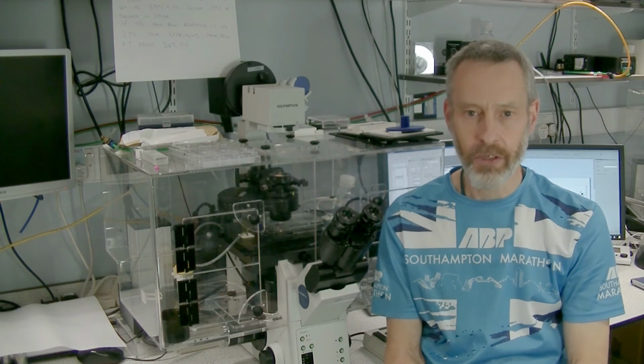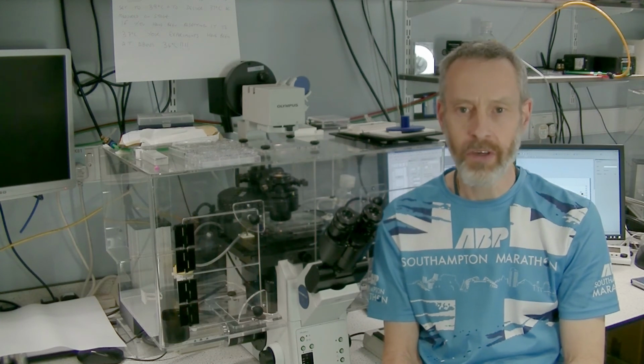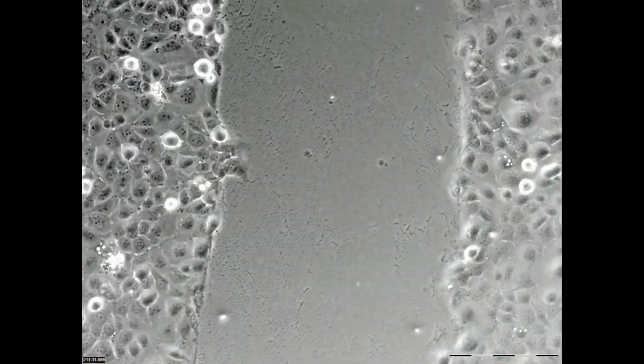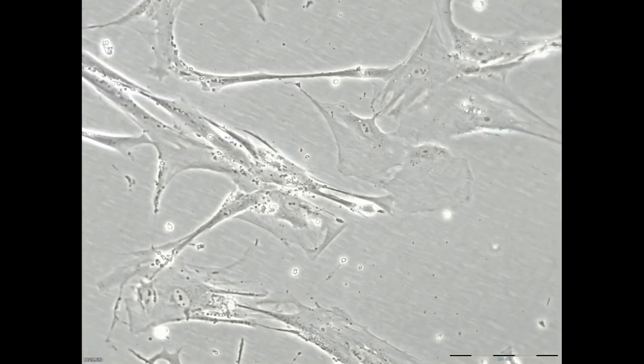Many cells in our bodies are not inert little blobs that just sit there. Many are actively motile, moving around or continually exploring their environment. Let's take a look. Here we see the sheet of cells on either side of a scratched wound moving together to seal the scratch. This is effectively what is happening under a scab after you've cut yourself.